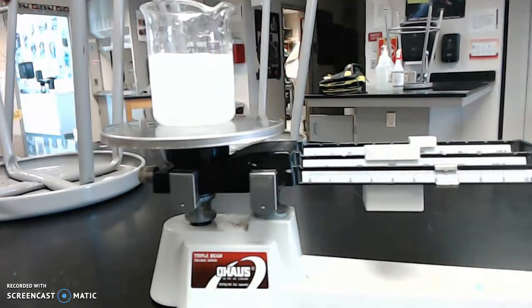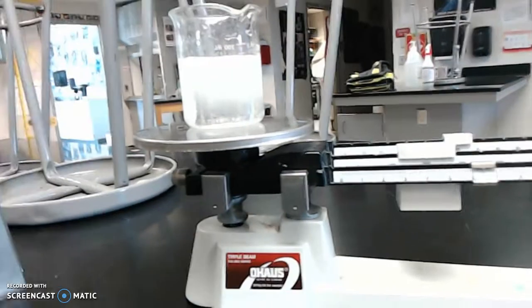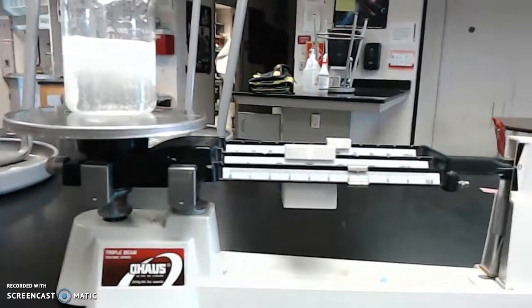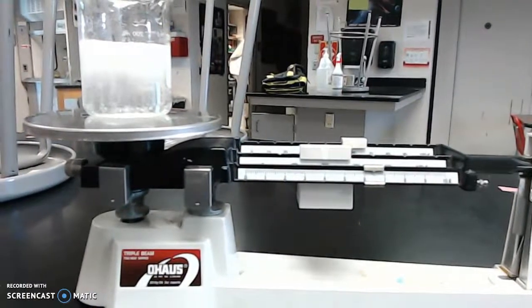We don't need to watch this thing fizz for about 3 or 4 minutes, so we will get the final data in a bit. But even so, as of right now, I can see that over on the right side, you can see that the arrows are not lining up on the balance. So we'll check back in a bit.